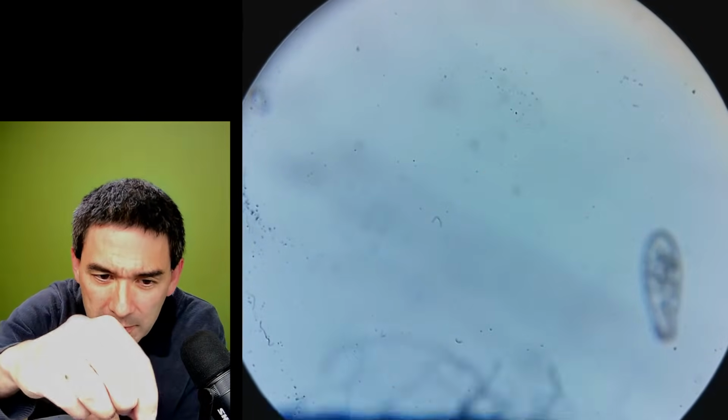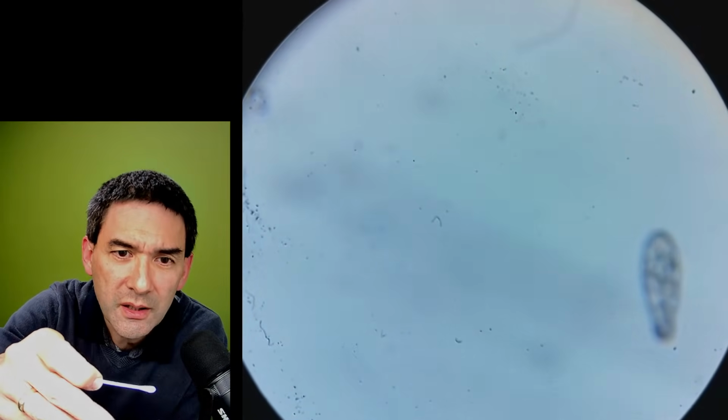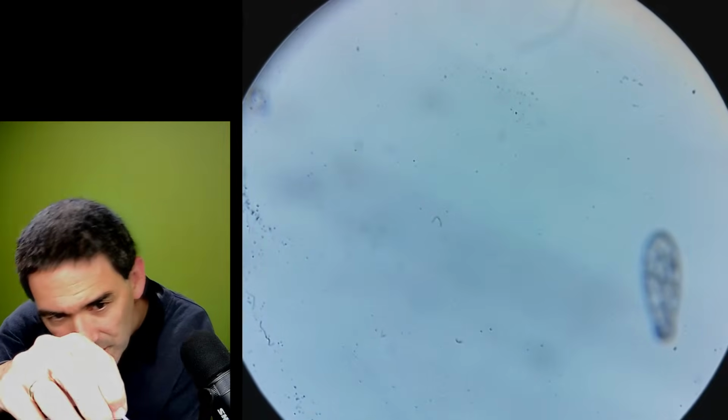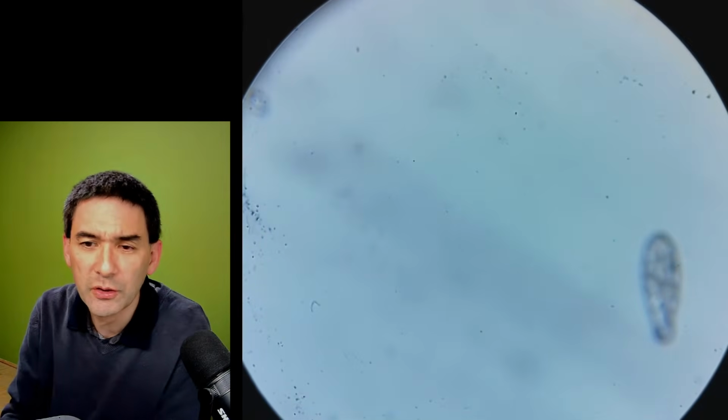No, it's still on here. I'm worried that this might be a little bit on the... I don't know where this is. See, it doesn't turn when I turn the... So this basically means it must be somewhere. It must turn along with it. I'm going to take this out. Let me see if this works now or not. It's still there. We just have to ignore this, I guess.